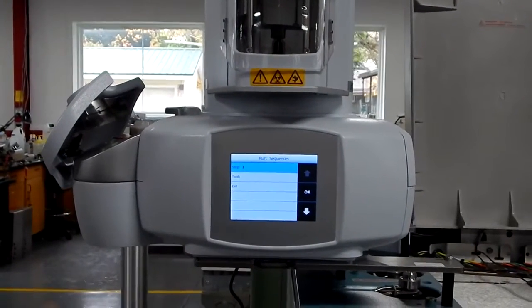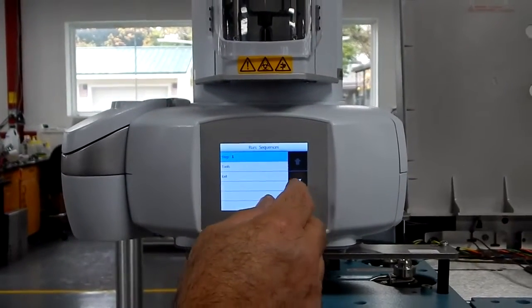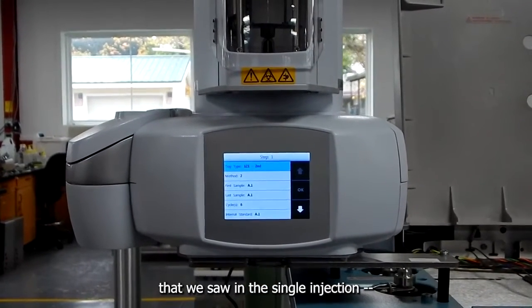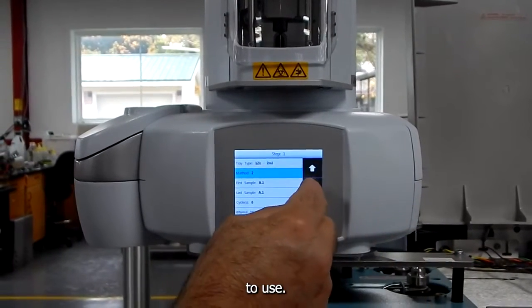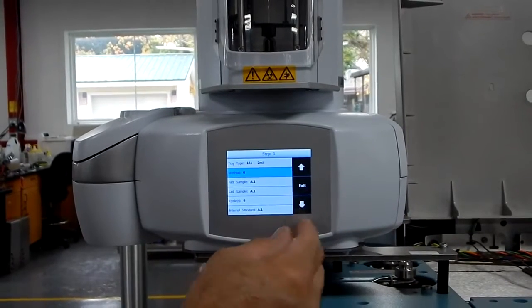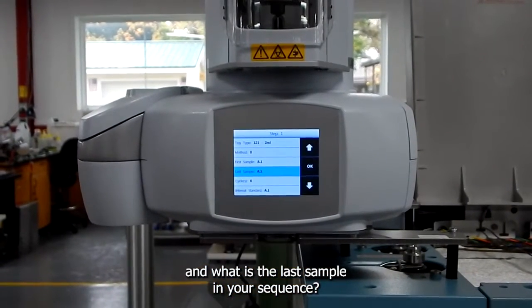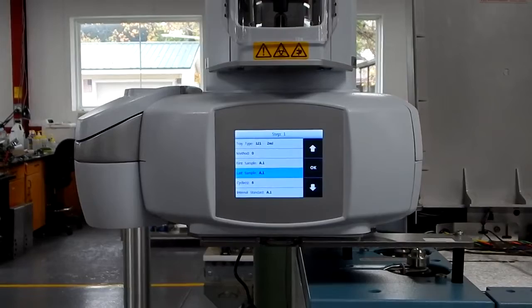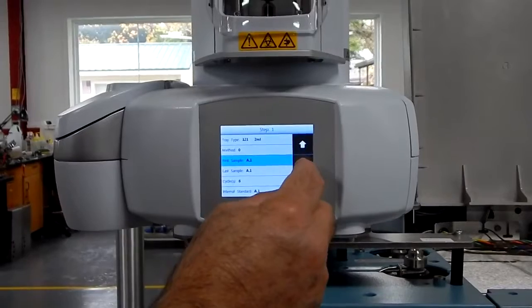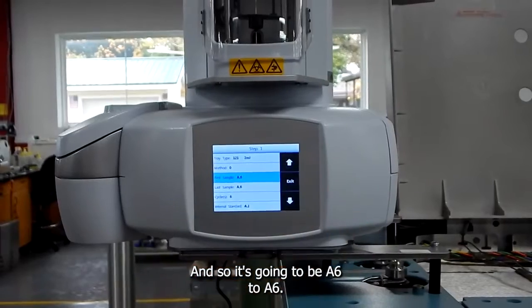And so step 1 is essentially sequence number 1. And if we hit OK, it will have the same things that we saw in the single injection. What method we want to use. Now this asks us what is the first sample and what is the last sample in your sequence. If you have 6 samples, it will be A1 through A6. We have something in A6 now, and so it's going to be A6 to A6.